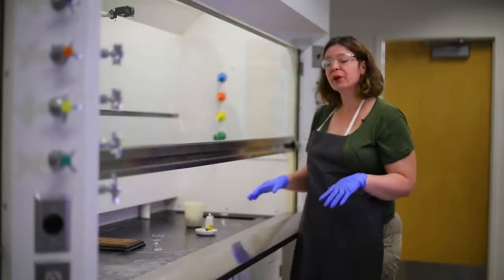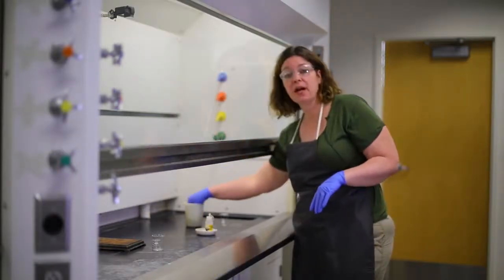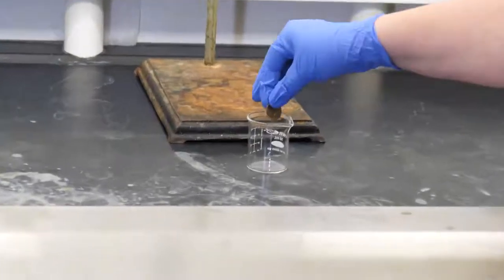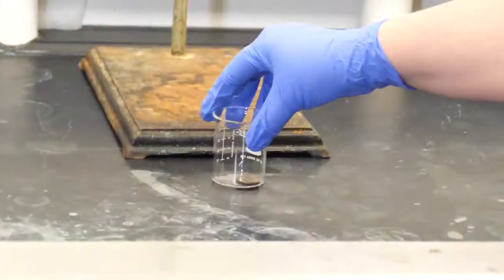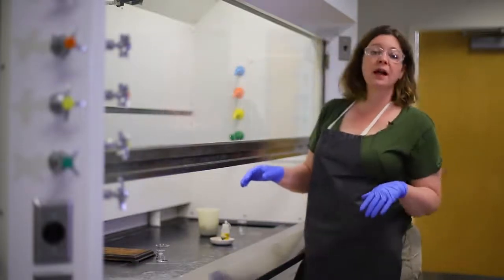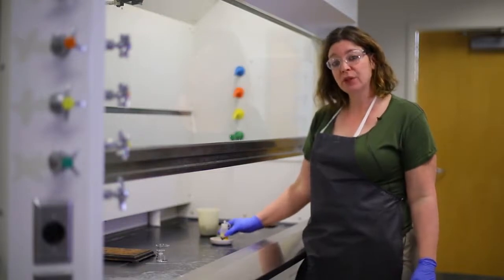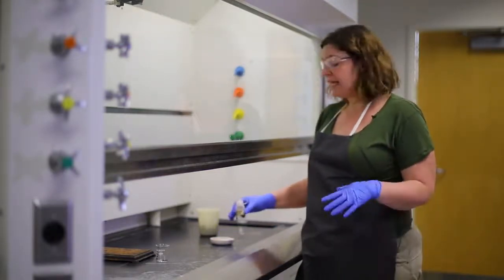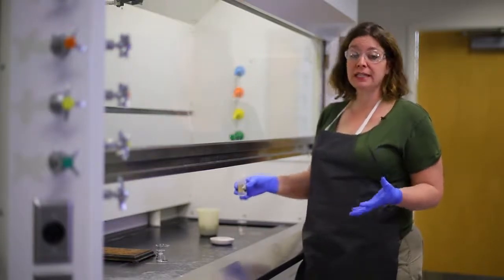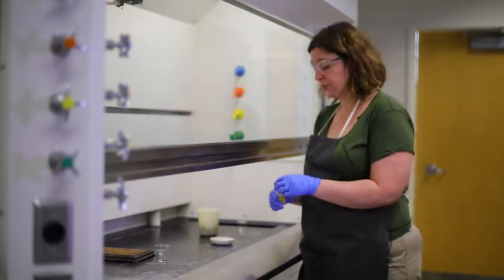In this demonstration, we're going to show you the effect of a toxic gas. I'm going to take a piece of copper. Literally, I'm going to take a copper penny, and I'm going to put it inside this beaker. I'm then going to dissolve the copper with concentrated nitric acid. You're not going to do this in chemistry lab this semester, but if you do have metals that come in contact with acids, it is very important to know that you can produce toxic fumes and vapors.